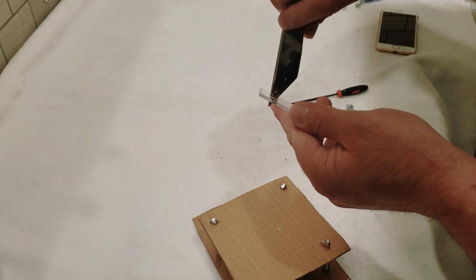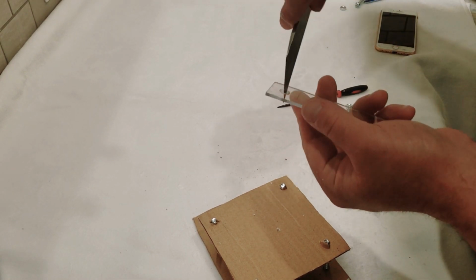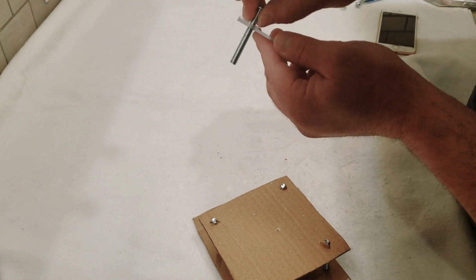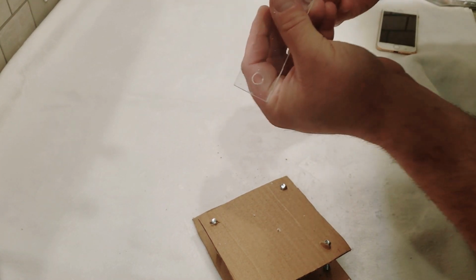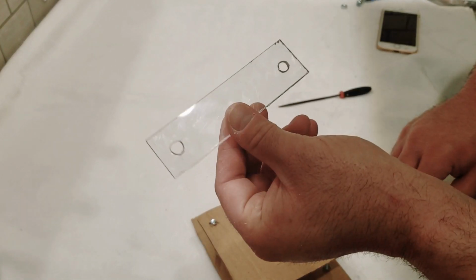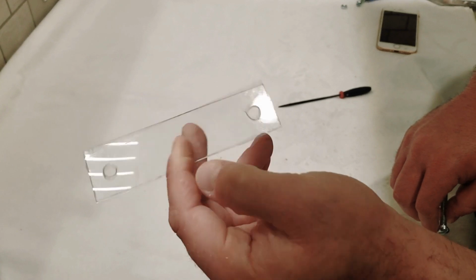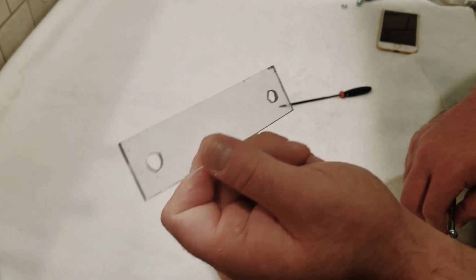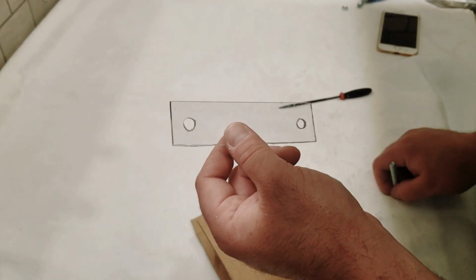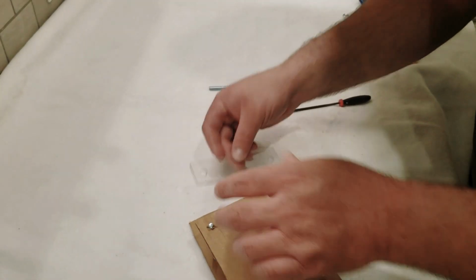All right, here we go. All right, let's check to see if that is big enough. Yep, they are both big enough. No, and that is by no means pretty. You can see they're pretty uneven. One's bigger than the other. Both probably a little bit bigger than I wanted them, but it works, and that's what's important.